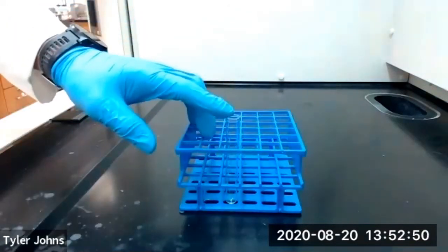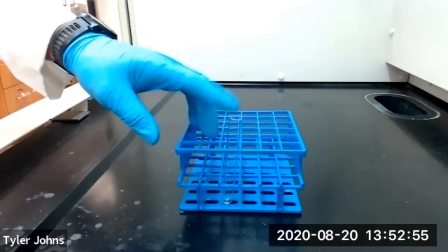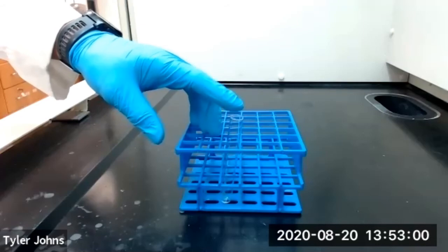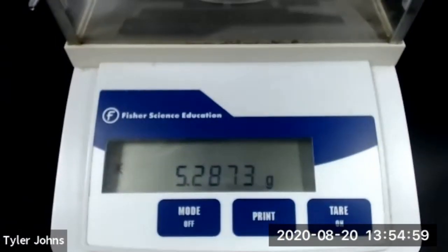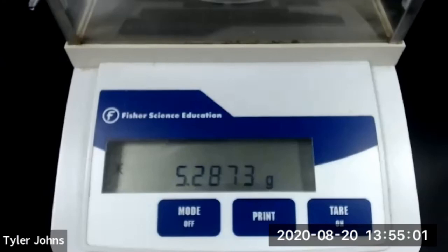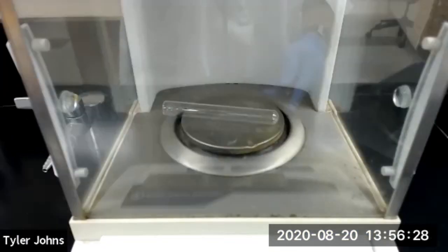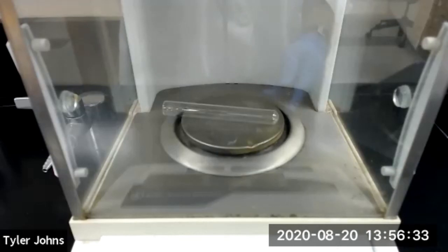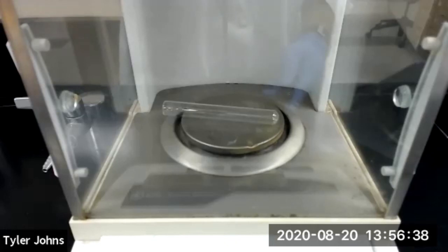We've evaporated off all of the methylene chloride from our pre-weighed test tube, so we'll now weigh our test tube to determine the mass of sodium benzoate that was in our methylene chloride layer. The mass of our pre-weighed test tube and sodium benzoate is 5.2873 grams. You can now determine the amount of each of our three organic compounds in methylene chloride and water, and you can also determine their distribution coefficients. This concludes part B of this experiment.